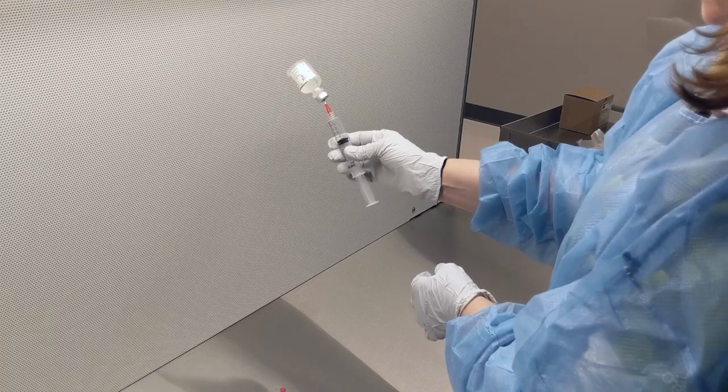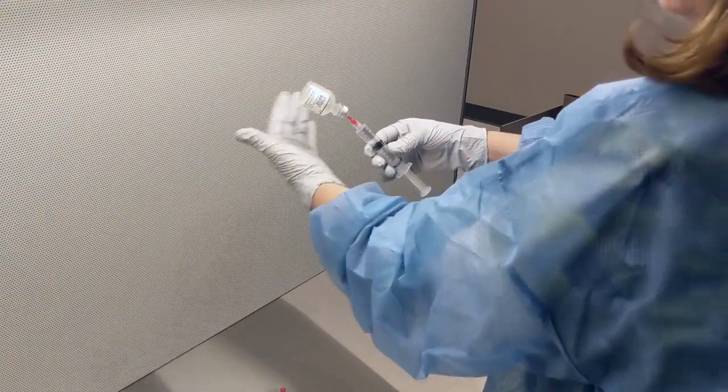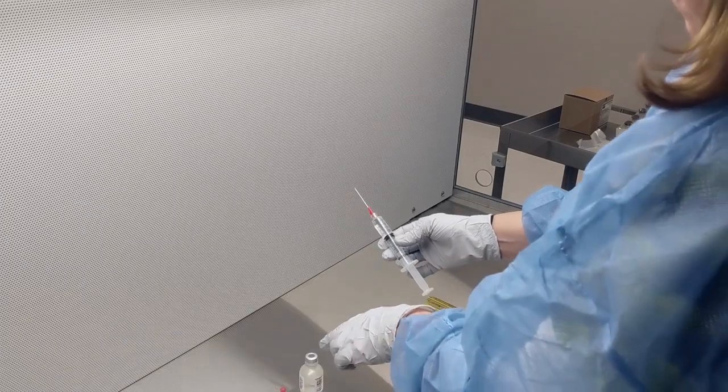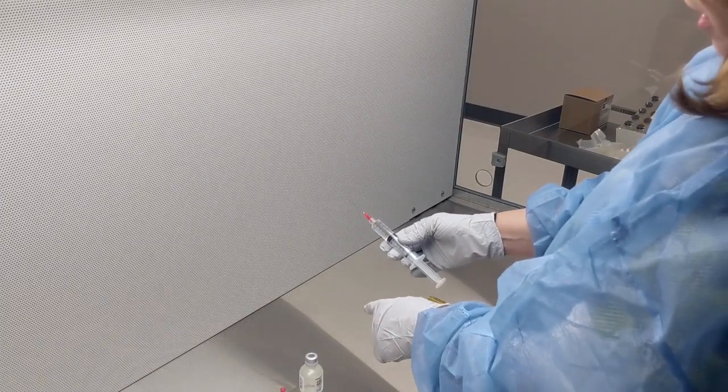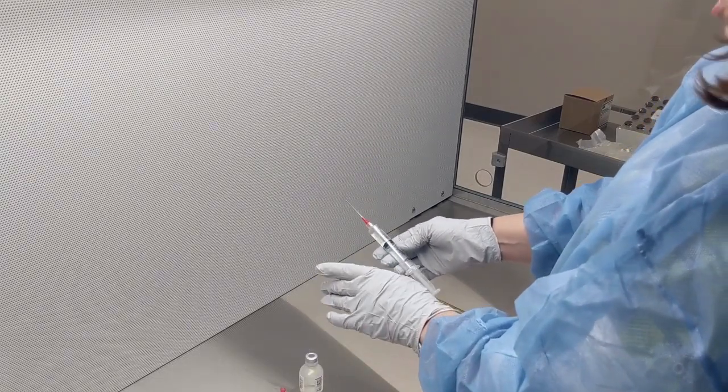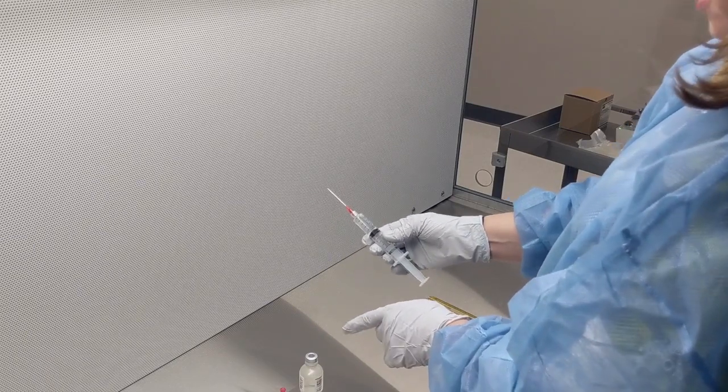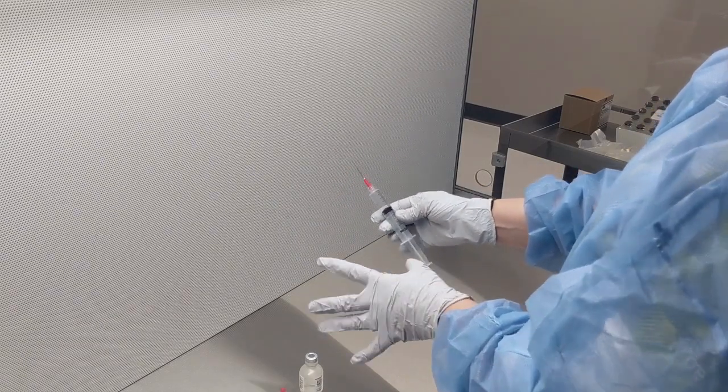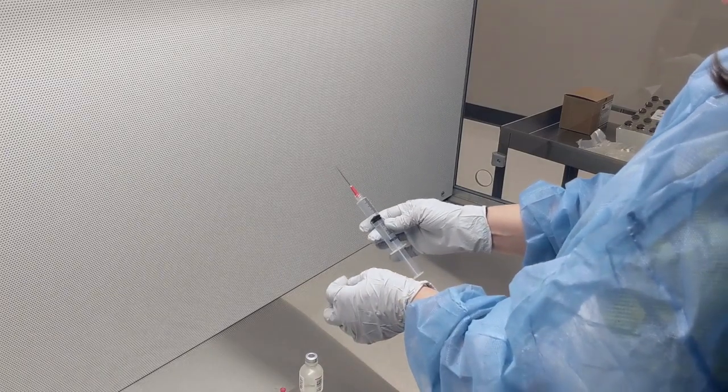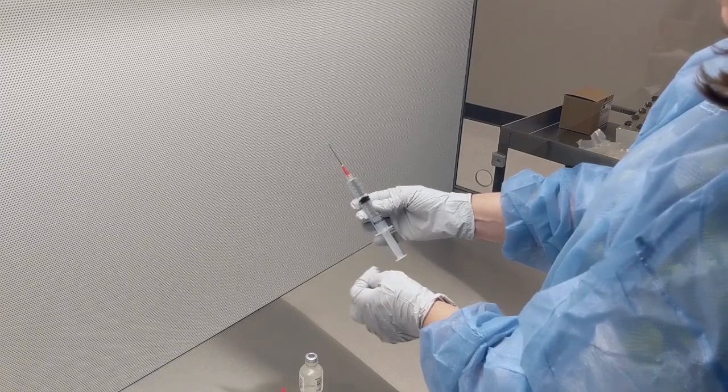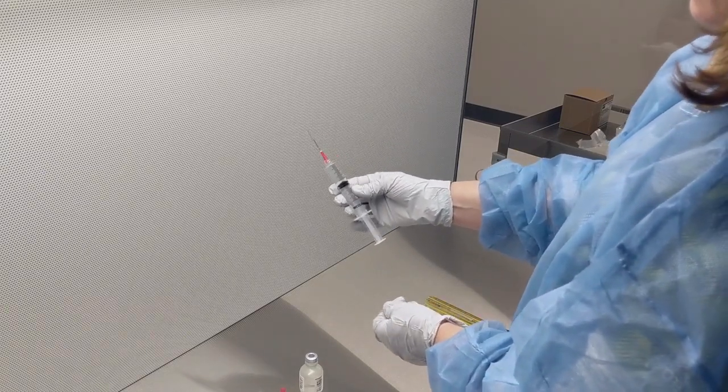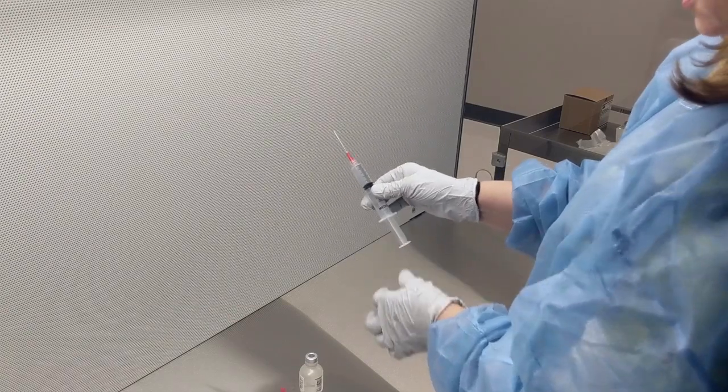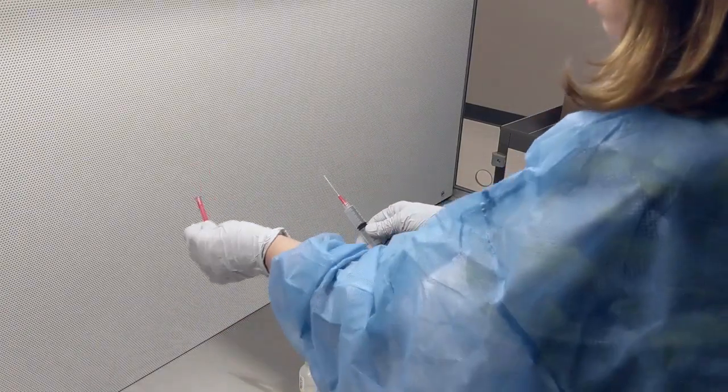And we did not block the air—just pull it out. Sometimes if there's a little bit of extra air in there, you'll get a couple drips of fluid coming out. That's not a problem; we'll just clean it up later. But there is a technique we're going to use to avoid that when we work with hazardous drugs. What I'm teaching you now is how to make sterile compounds with non-hazardous drugs. But when you have hazardous drugs like chemo, you do not want any fluid coming out at all because it could contaminate you. So now we have the right amount. We have to cap the needle and get rid of that in the sharps container. If this were to go to the nursing floor, we would have a special little cap, label it up, and send it up.